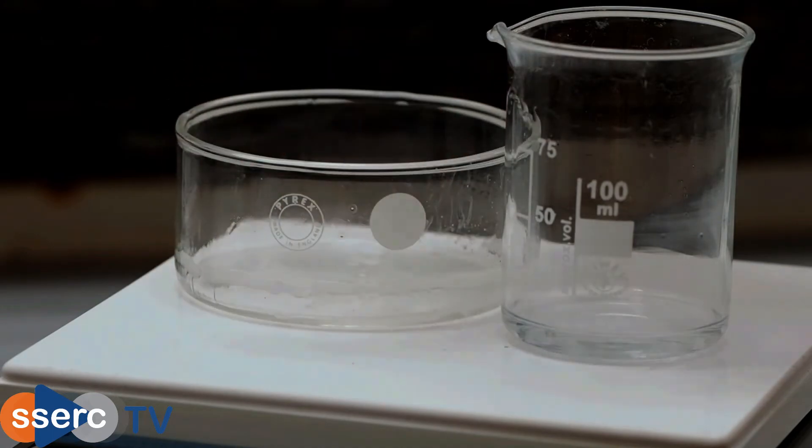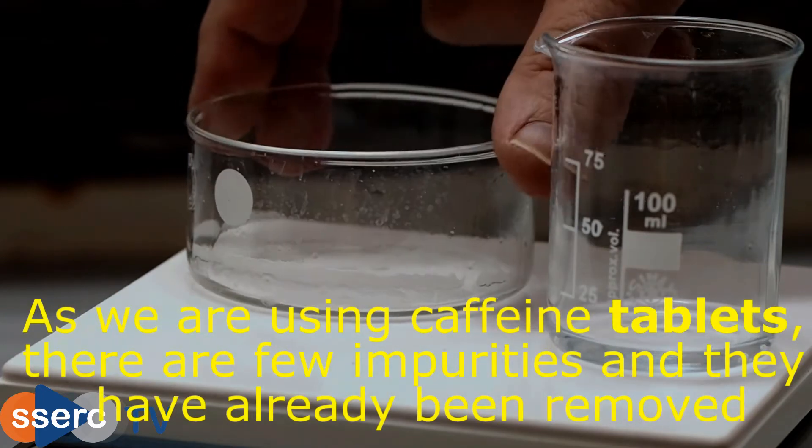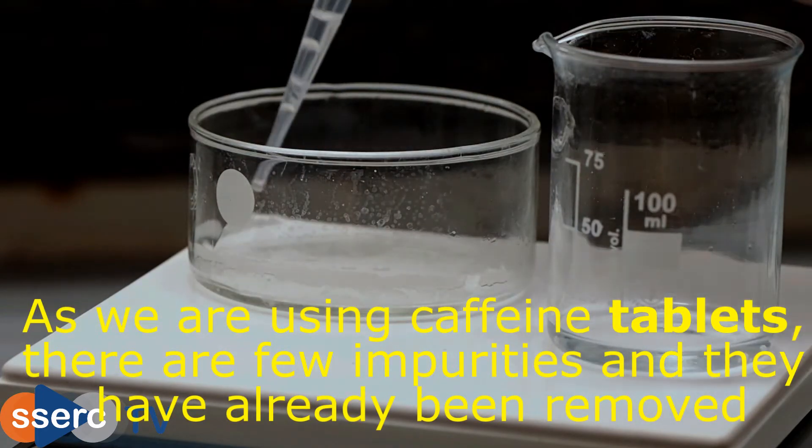In some cases you may need to filter this solution while it's still hot to remove any impurities that do not dissolve, but in this case there are no impurities that need to be filtered out.